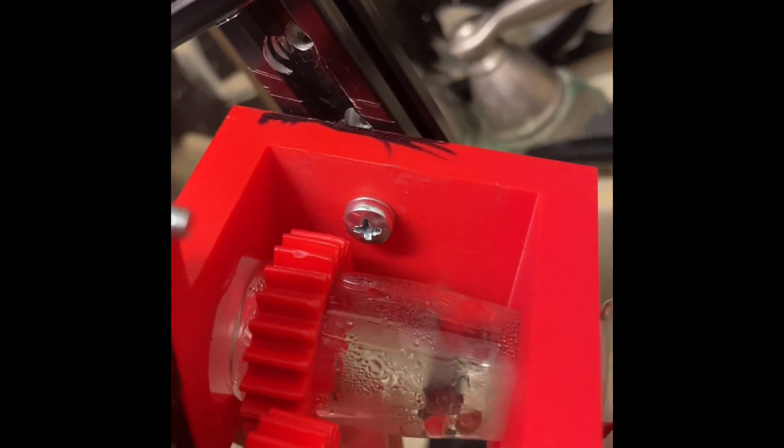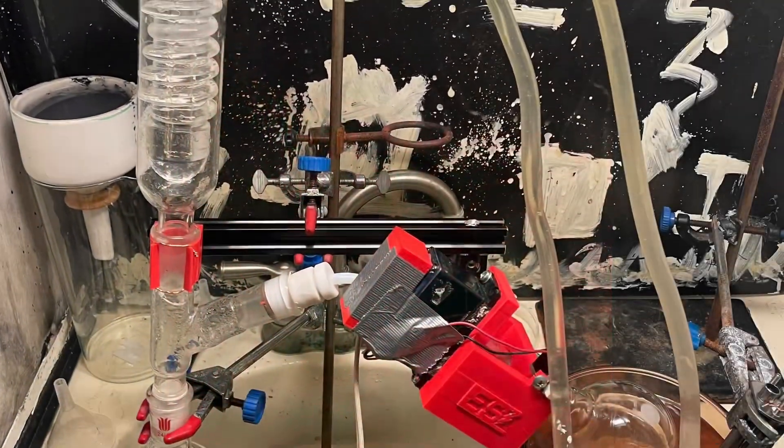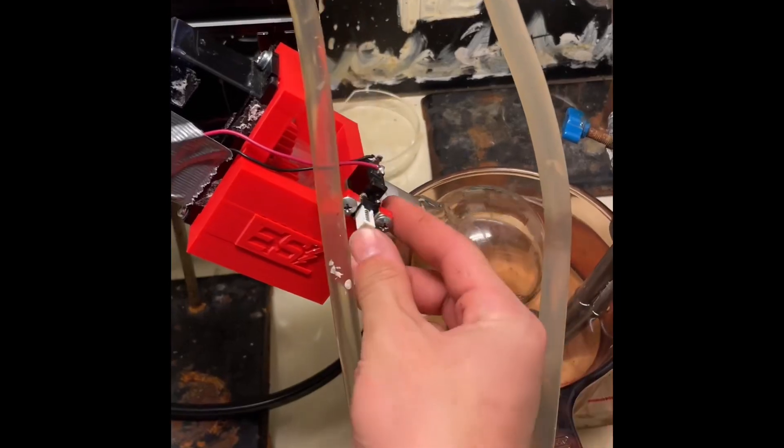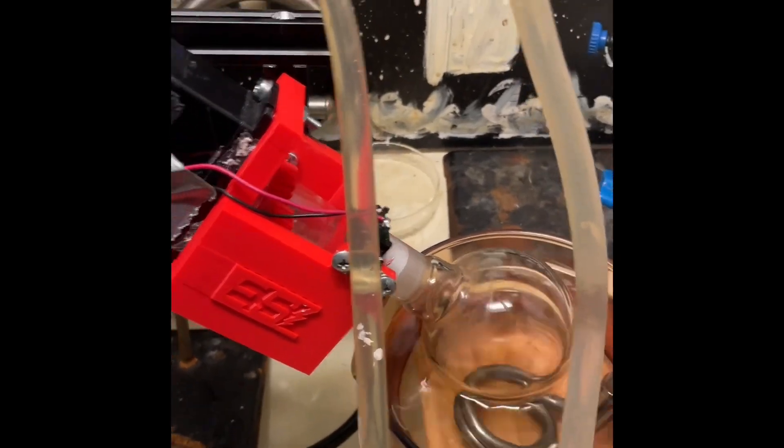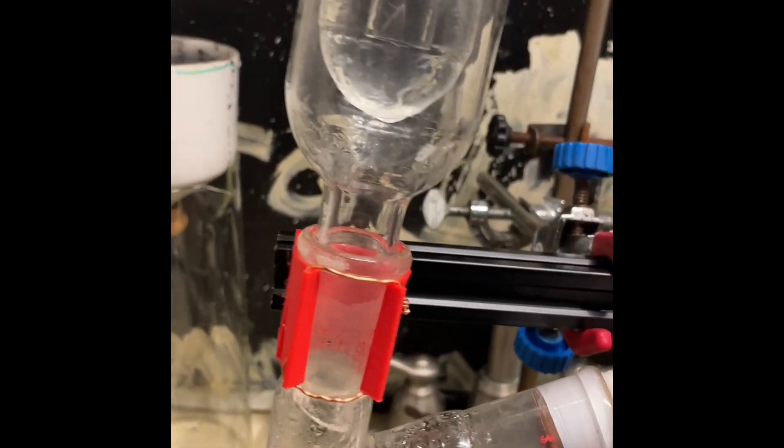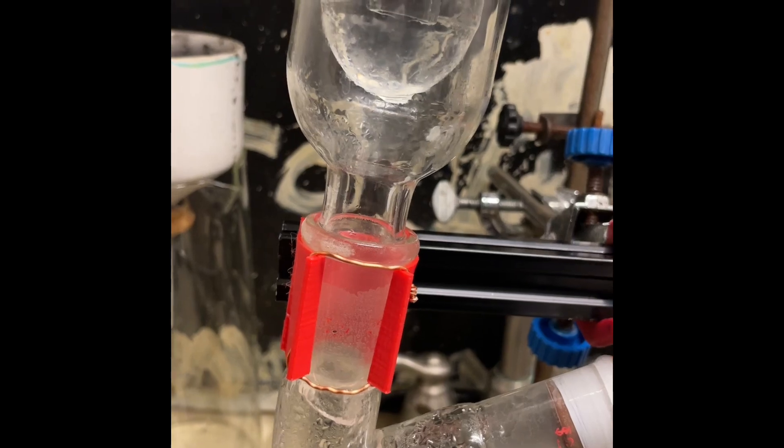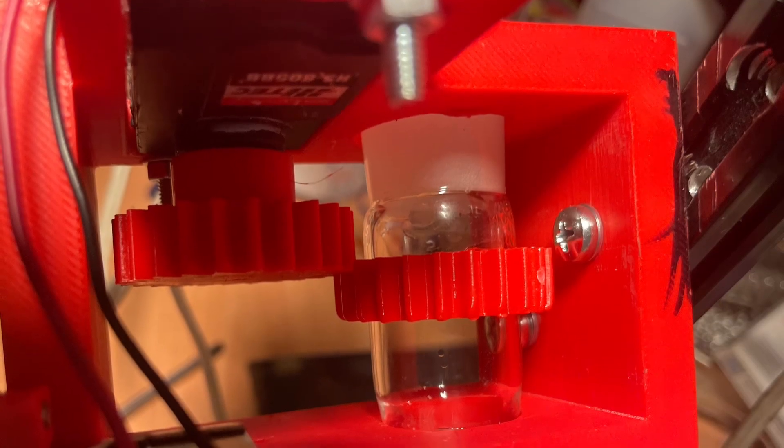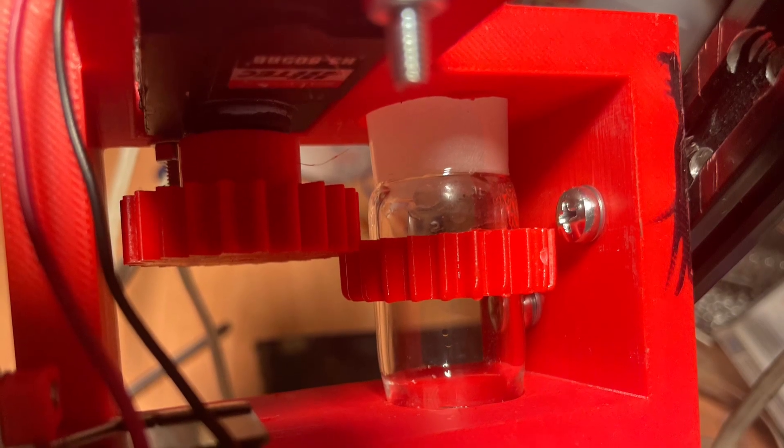The PLA got too hot and slipped off the glass, so I put some super glue on it. There's the rotavap, I'll be using this in many future videos. I also designed this little clamp to hold the glass onto the extruded aluminum.